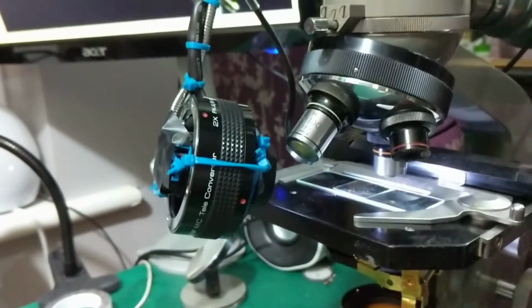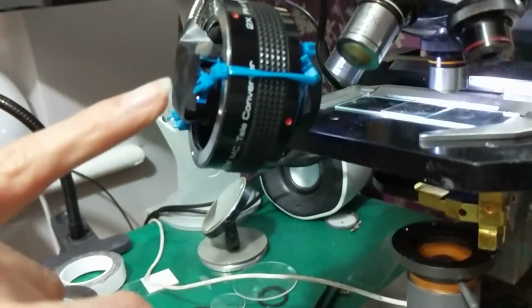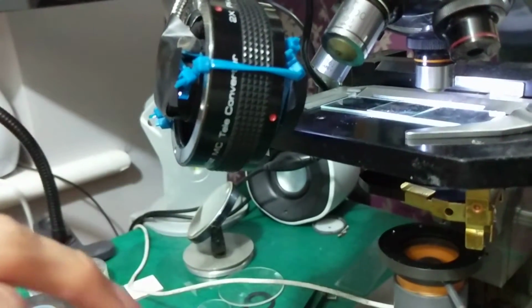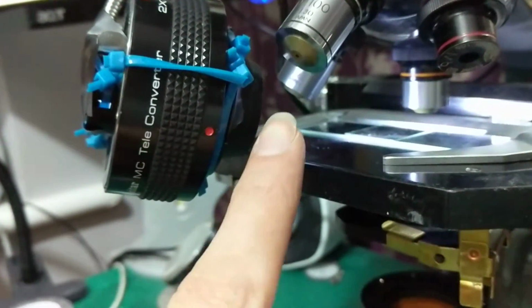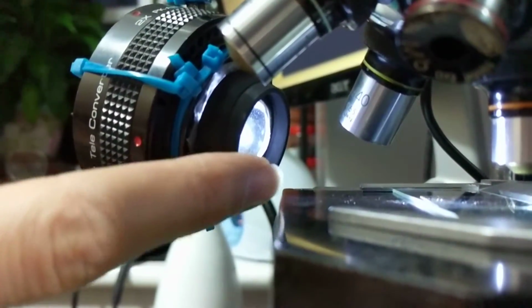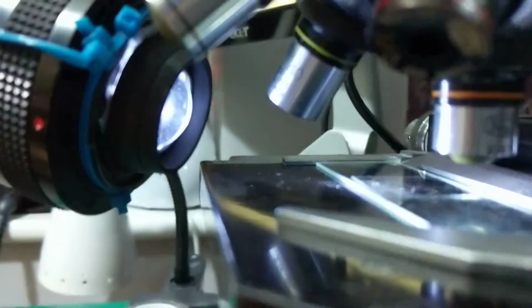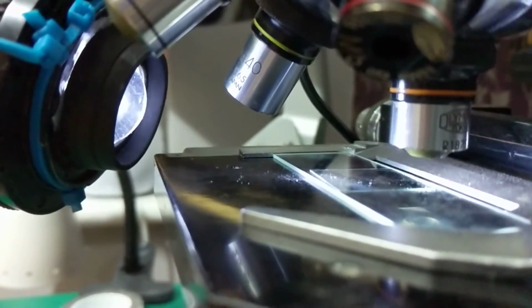This is what I've come up with. So it's an old teleconverter with all the bits inside taken out, and then I've jammed a torch head between this plate and the body, and then there's a lens attached at the front with a piece of plastic bag behind it. Sorry about all the jumping about. There's a piece of plastic bag behind there as a diffuser, and then we've got a lens on the front to refocus the light, and the focus point is pretty much exactly on the slide. Well, we're not too far off anyway, so it's not too bad.